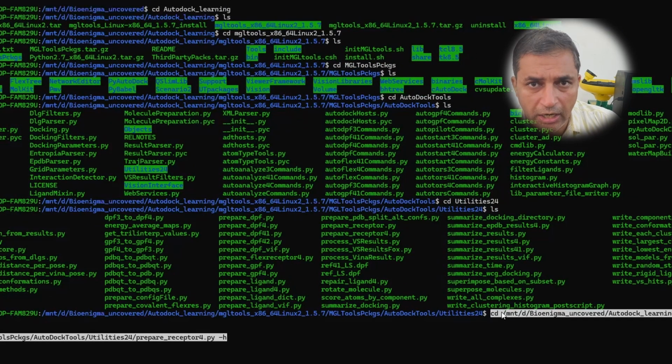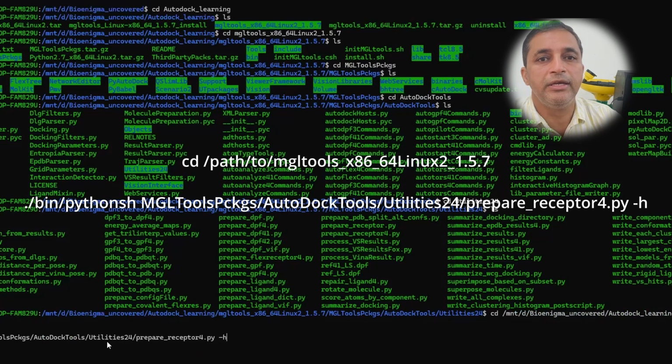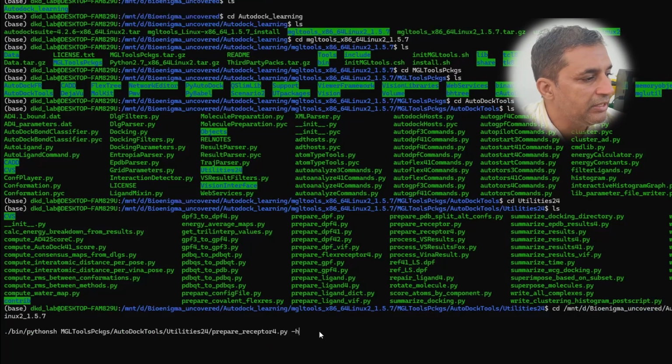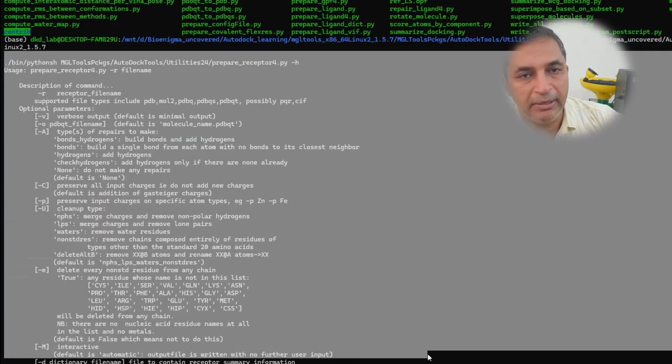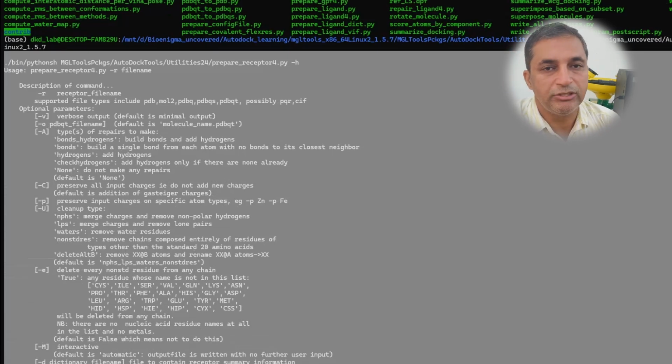However, to establish 100% that our installation has been successful or not, type the command as you can see on your screen. This command will give you all the prompts related to the help if required during the processing of this MGL tools. And you can see the various help prompts or commands and their descriptions now appear on our screen. Appearance of all these help commands establishes that our installation is now 100% successful.